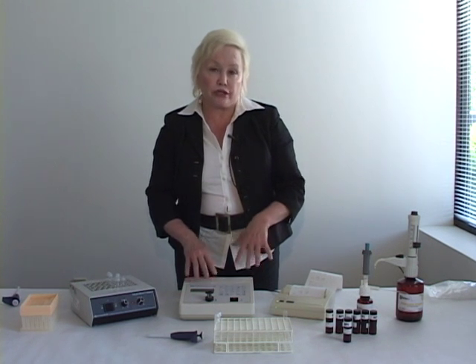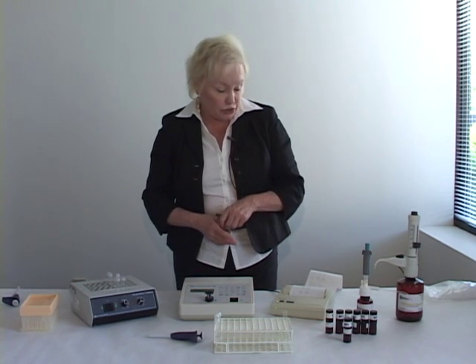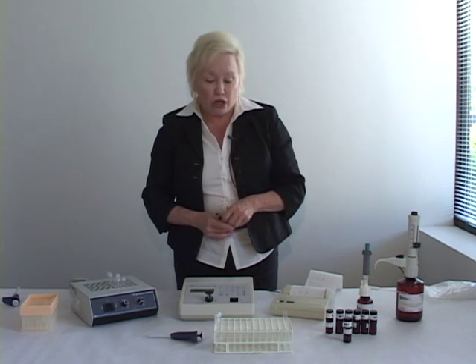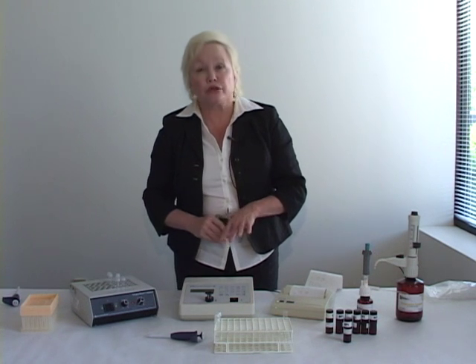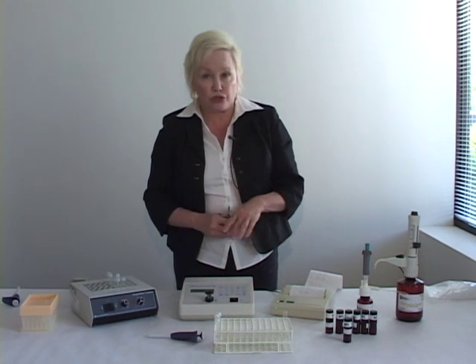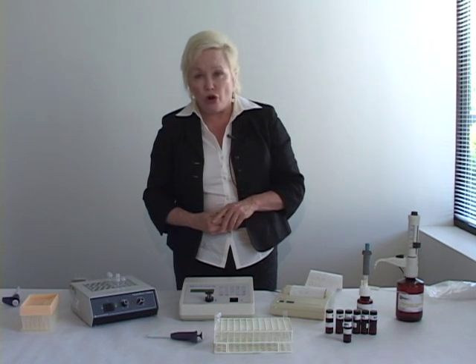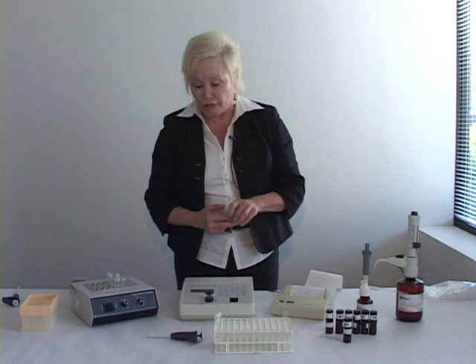So as you can see, it's very easy to calibrate, and once it's calibrated, it's very easy, ongoing throughout the day, to run total glycerin and check your reaction completion. All of the equipment that is here comes with the test platform, including the disposables and the initial kits to set up your methods and begin running free fatty acid or acid value, as well as free and total glycerin.